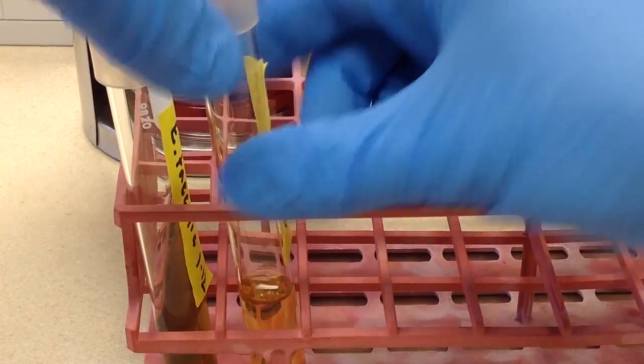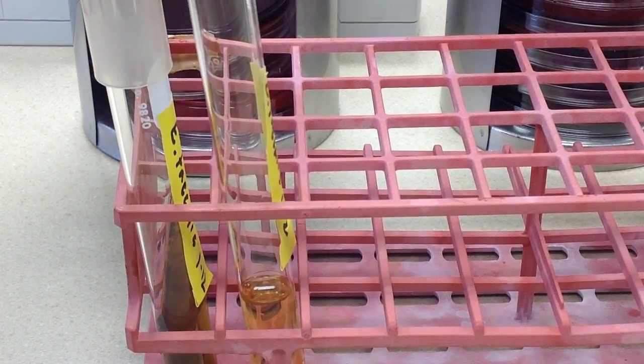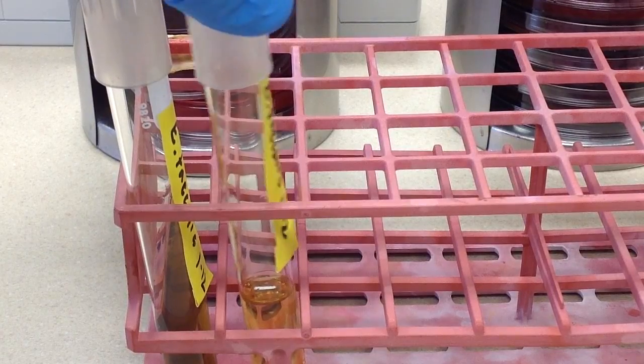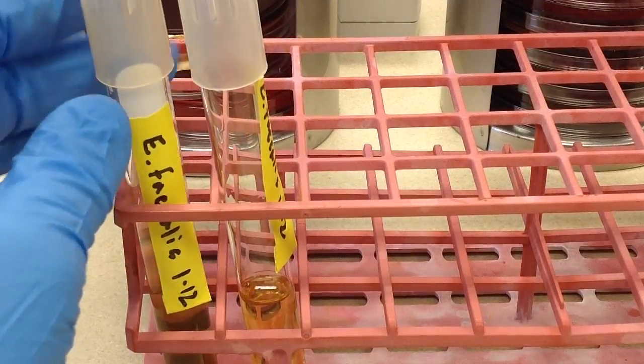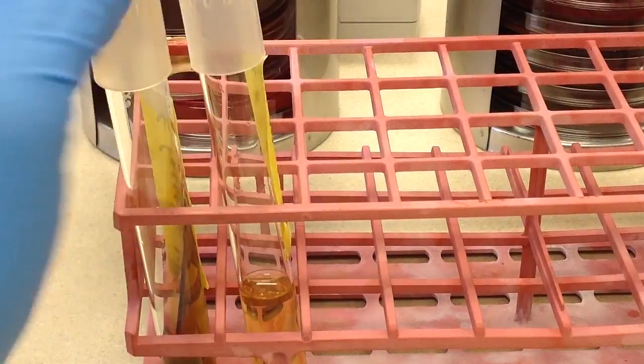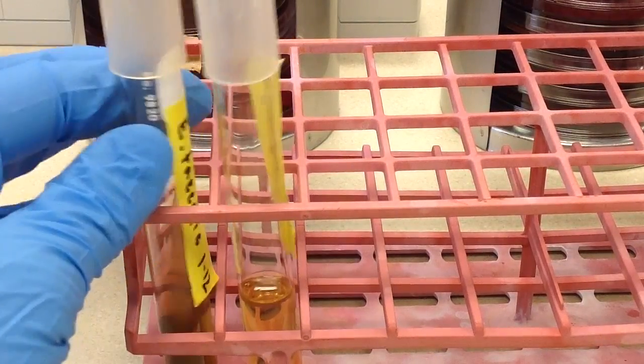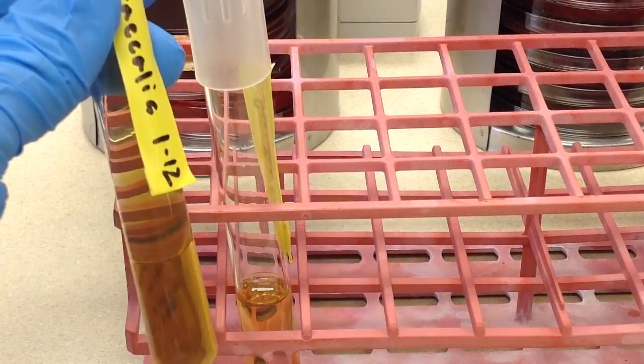Because if the person before you put it on too loosely, and you pick it up, what can happen is the whole thing will end up on the floor broken, and you're going to have a very big mess. So, we're just going to go ahead and lightly put those on. Whenever we pick up these tubes, we're going to pick them up from here.